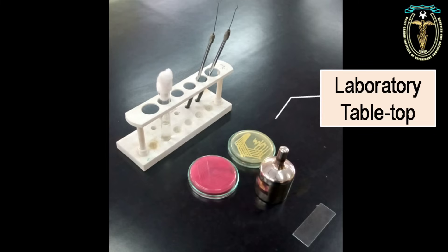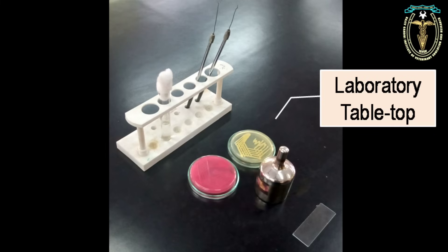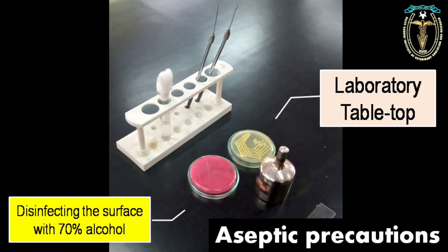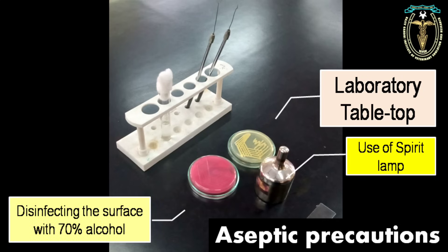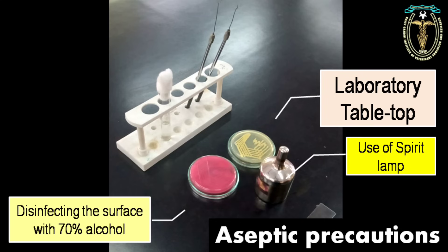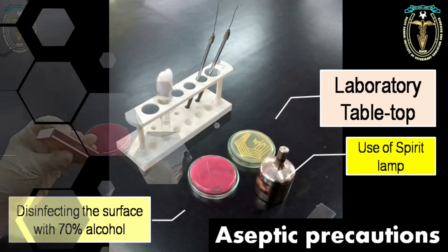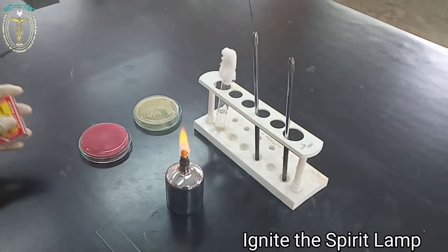This experiment can be conducted over the laboratory tabletop with certain aseptic precautions, like disinfecting the table surface before the experiment with 70% alcohol and by use of a spirit lamp or Bunsen burner while conducting the experiment. First, ignite the spirit lamp.